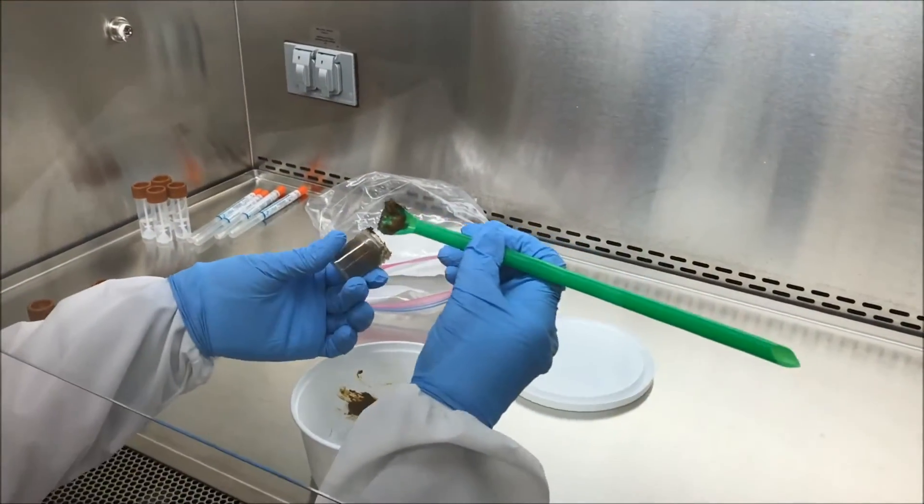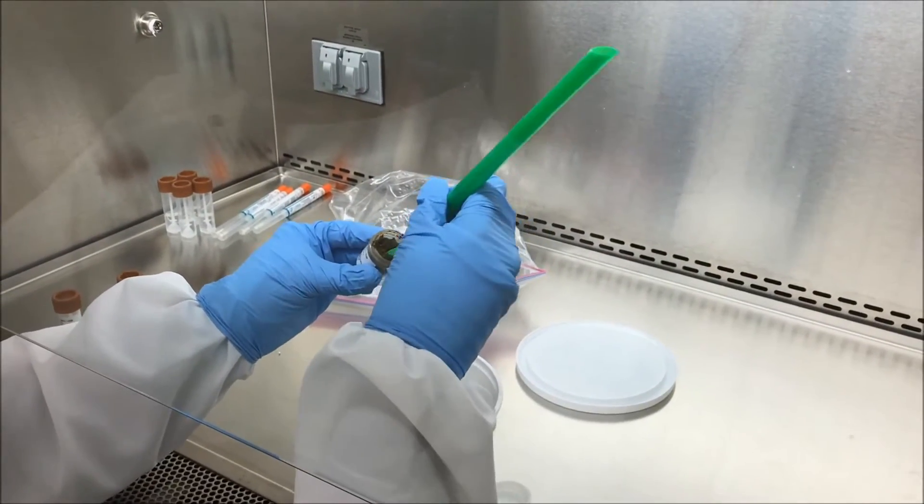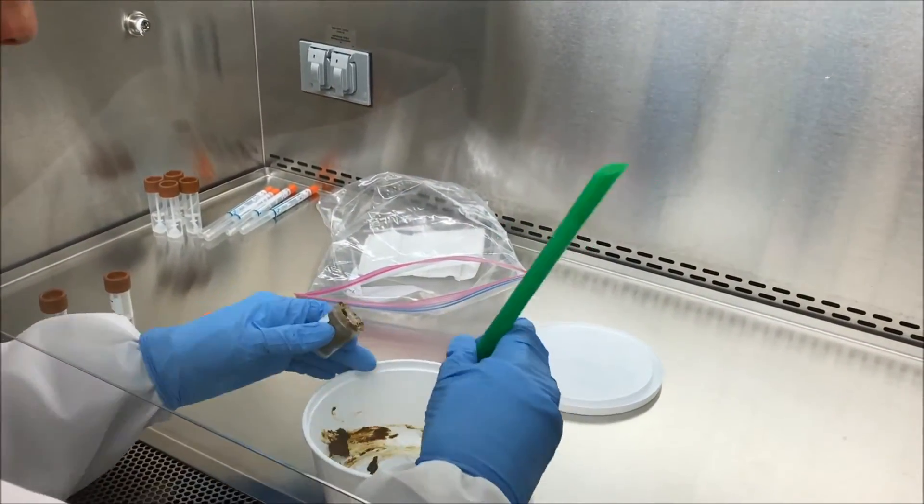We try to fill the cryo tubes as much as we can because these are frozen stocks for when we need to go back to the primary sample.